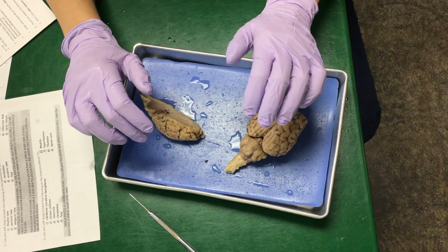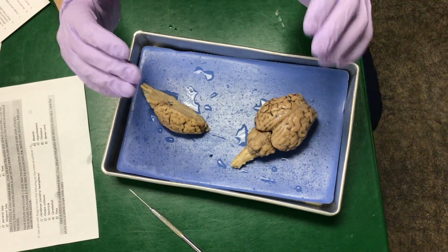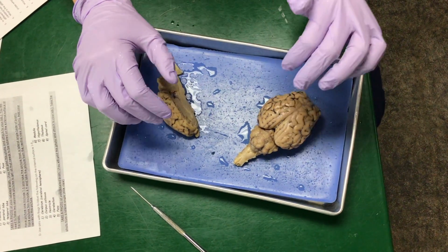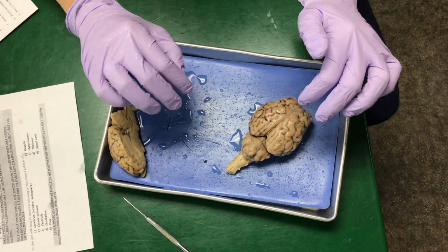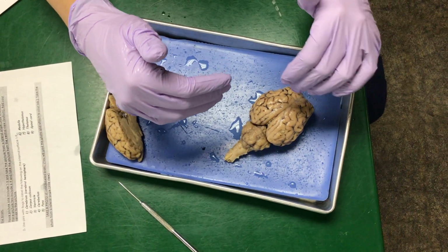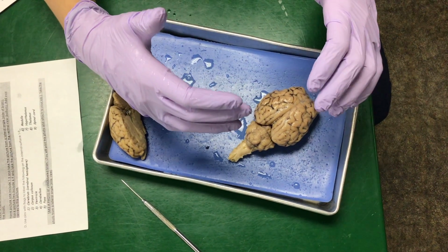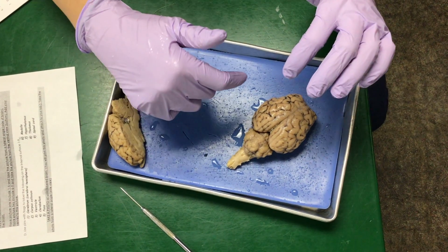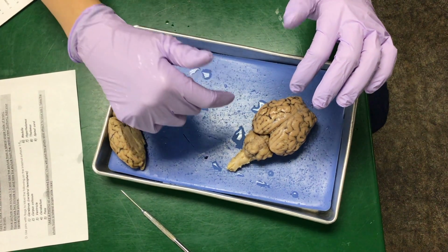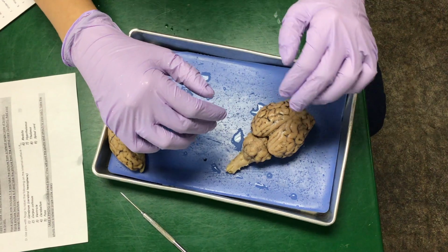All right, so we're gonna take a walk through the brain dissection lab here. You need both a half brain and a full brain when you go through this, but we'll first go through the full brain. What I'm gonna have you do is eventually, I'll talk through some of the stuff on here, and then there's gonna be a picture of it. You need to label that picture with the stuff that is on the lab sheet and obviously answer the questions, and that's what you'll be doing for this lab.